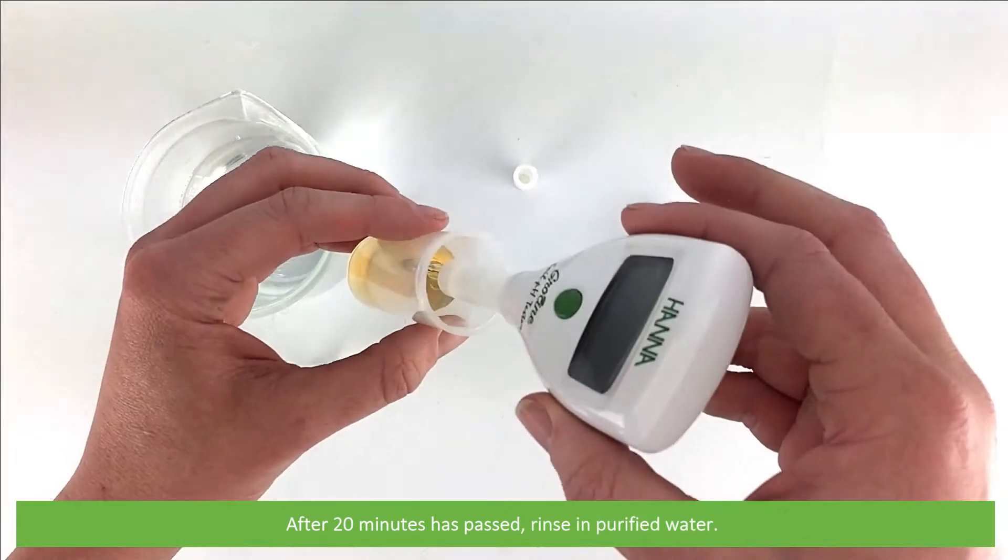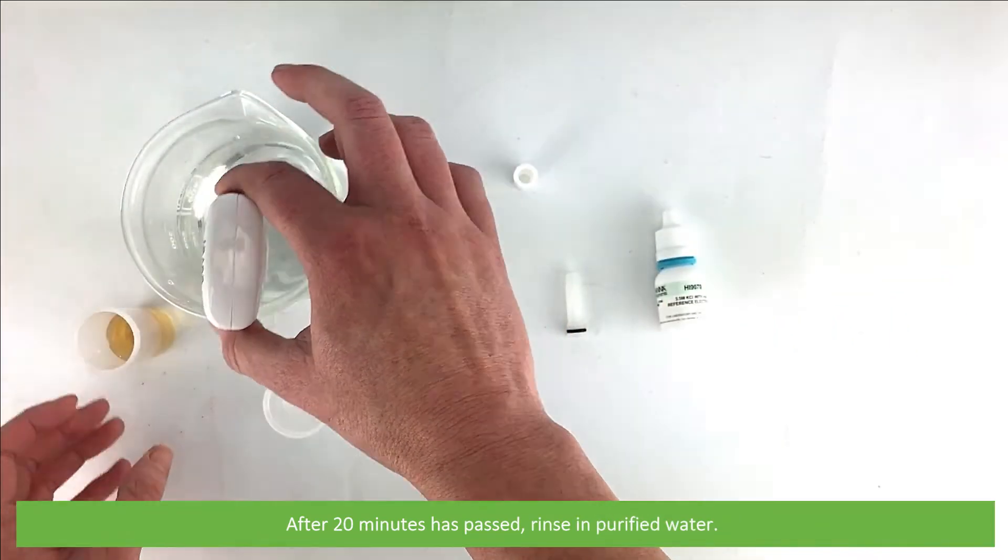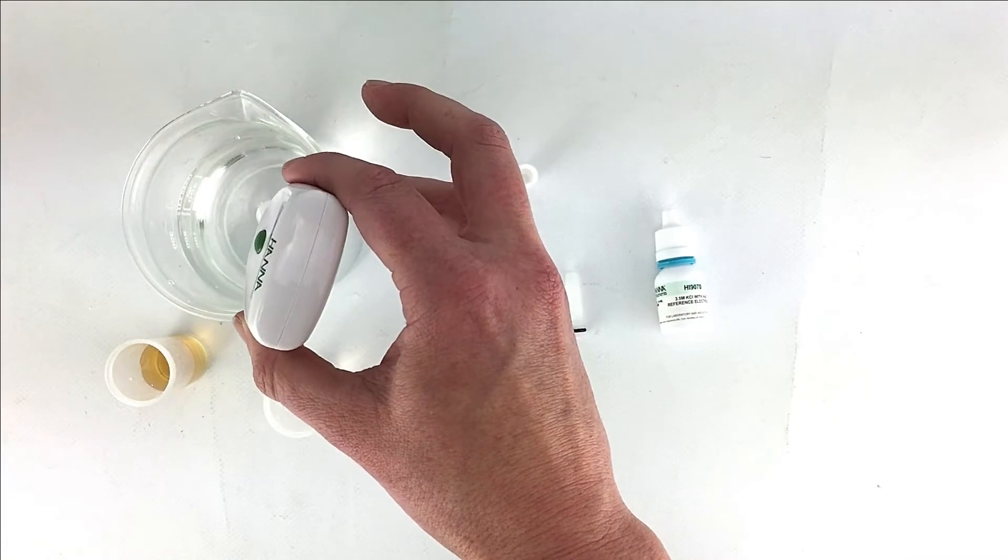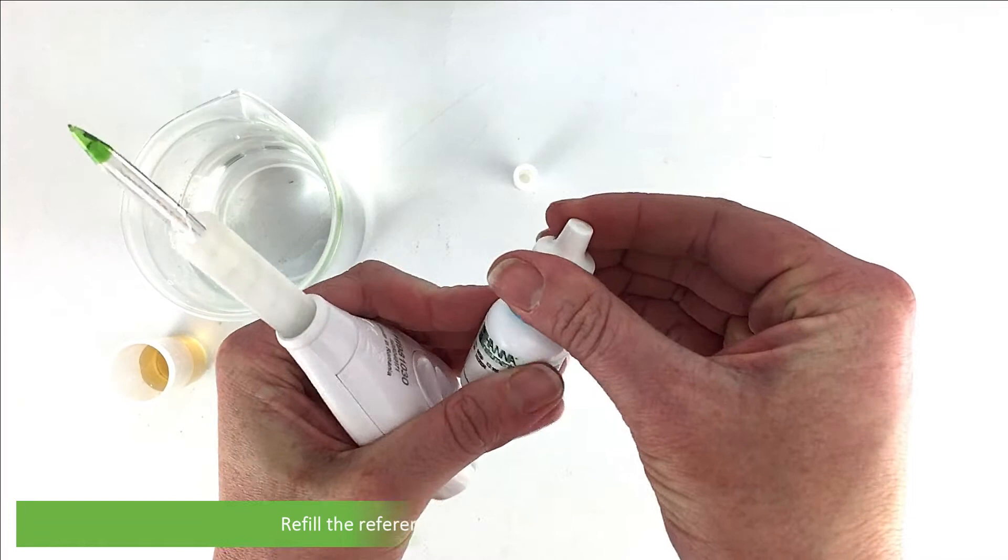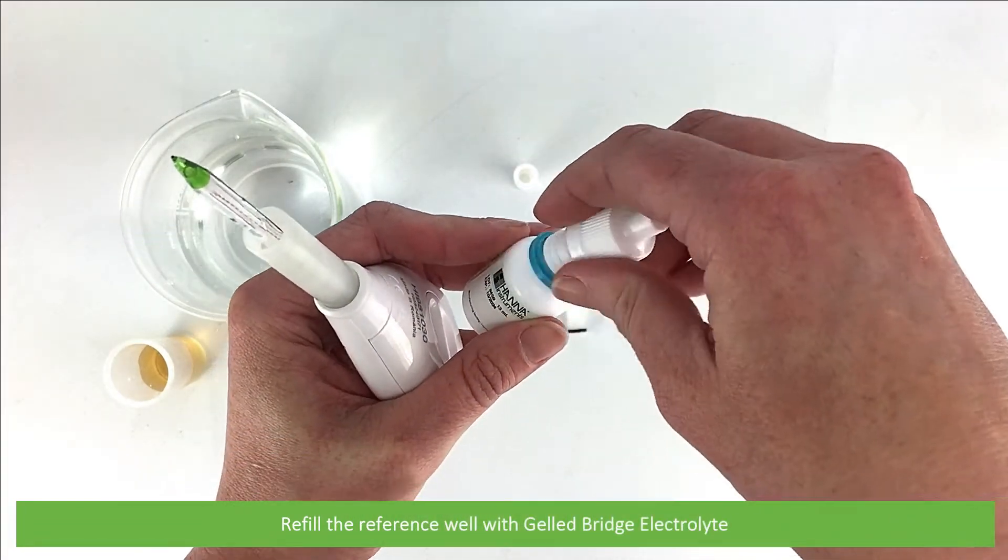After 20 minutes has passed, rinse in purified water. Then refill the reference well with the gelled bridge electrolyte.